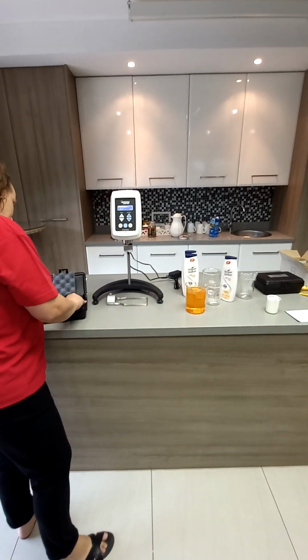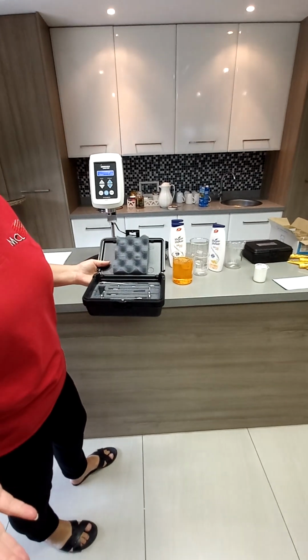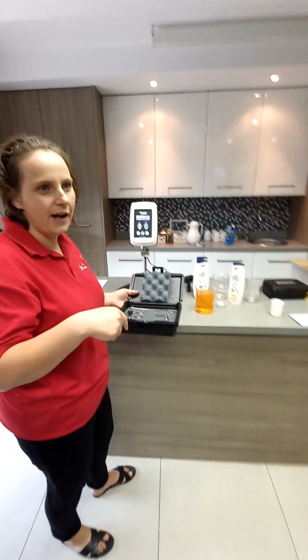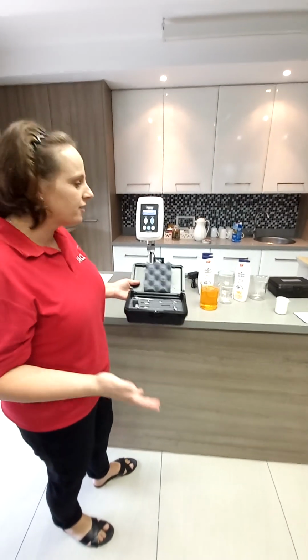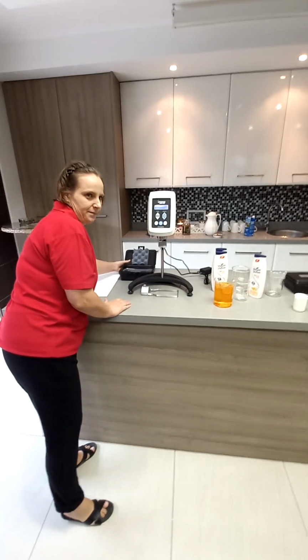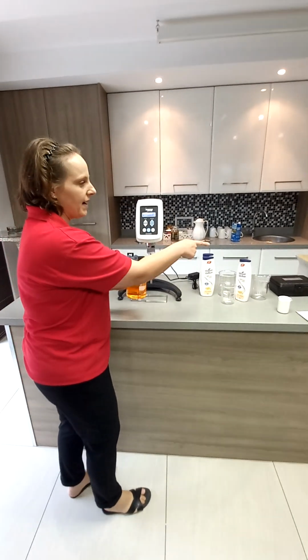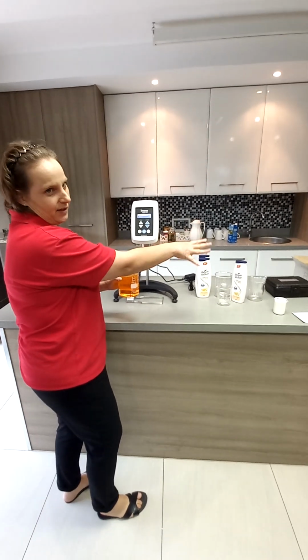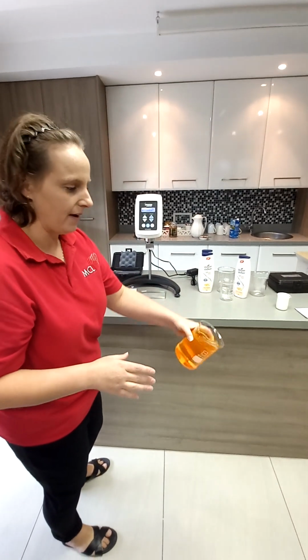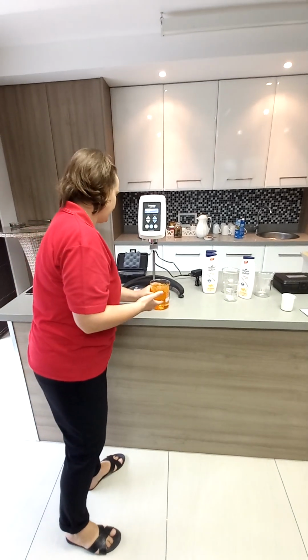So there are 6 spindles here. So how do you know which spindle to use? Plus the machine can rotate at different speeds. What speed are you going to use? It's trial and error, but we will slowly go through it. We're going to start with this sample. I'll come back to the other spindle set after we've done this one. We don't know the viscosity of this sample, so we need to test it.